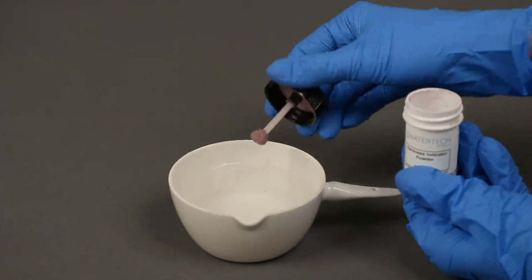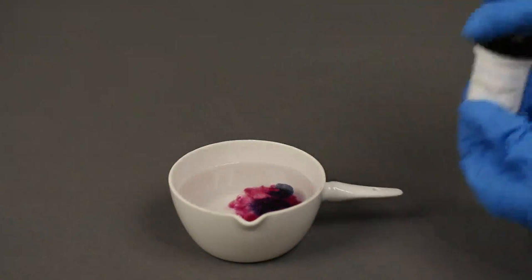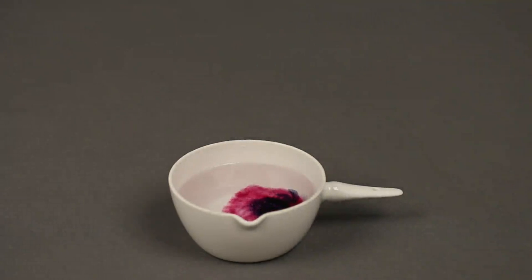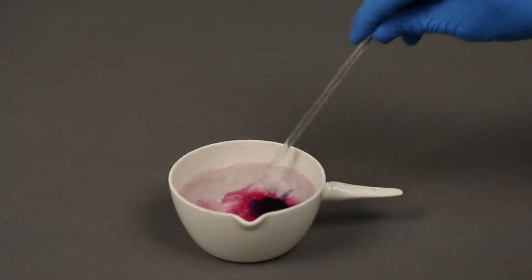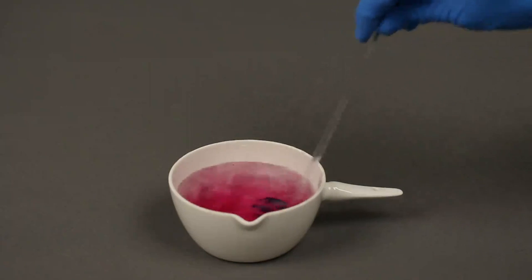If the water turns blue in color, no hardness is present and the hardness is reported as zero. If the water turns purple or red, hardness is present and the test should be continued.